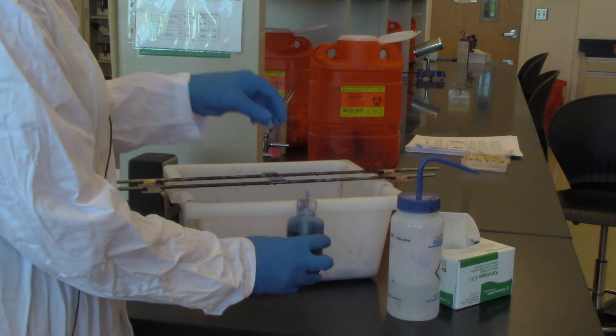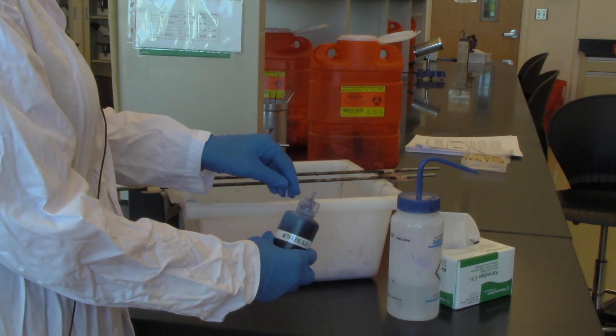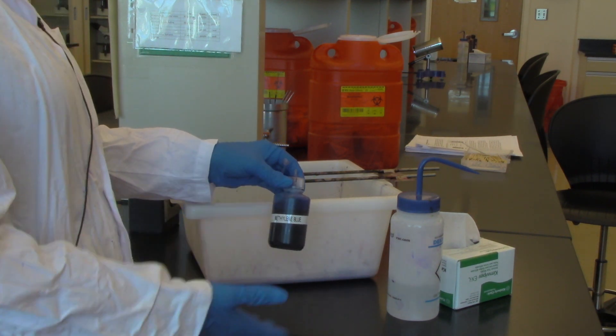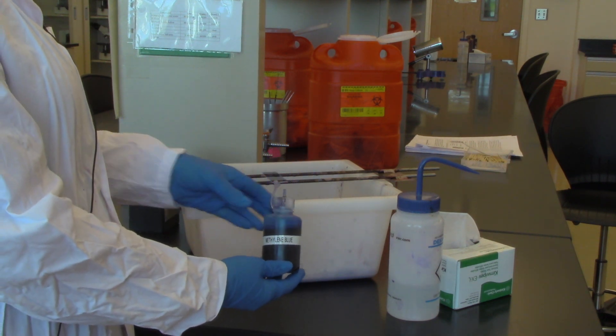I'm going to take my simple stain. There are different simple stains that can be used. Many of the simple stains are basic and do have a positive charge, not all of them.